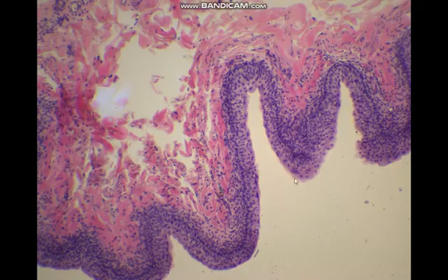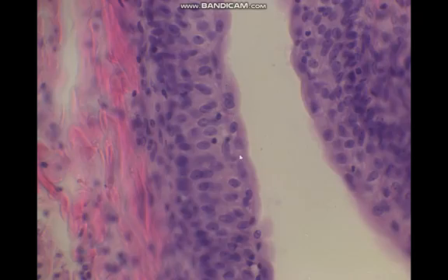Transitional epithelium, which is a specific epithelium found in the urinary system. In this section, we have a section in the urinary bladder that is lined by transitional epithelium. This epithelium is capable of relaxation and contraction. The apical row of cells are specific, called dome or umbrella cells. Under high magnification, these cells can be seen to be large, project to the lumen, and sometimes appear binucleated, two nuclei per single cell. This is a binucleated cell. So this is a characteristic feature of the transitional epithelium.